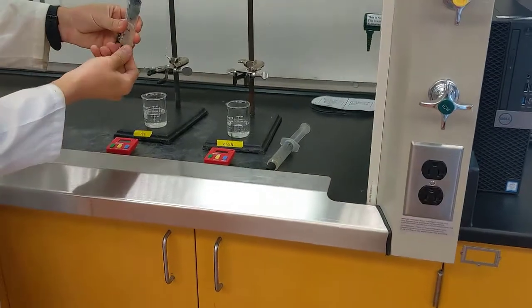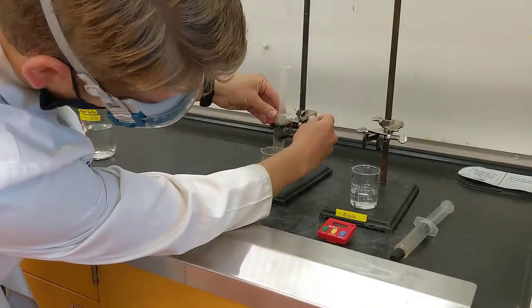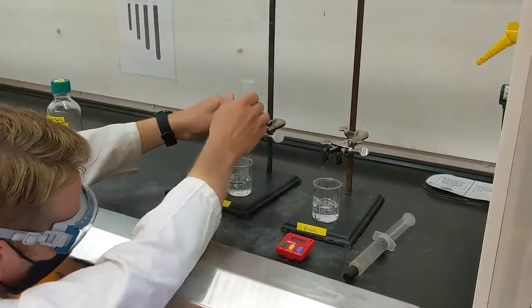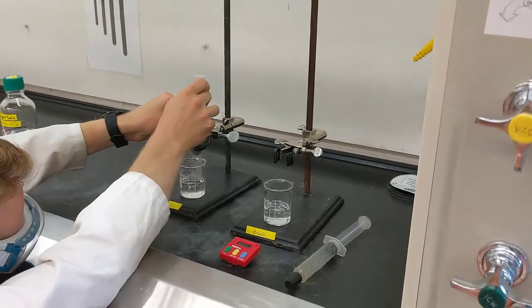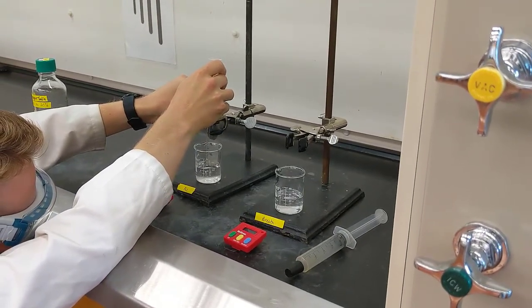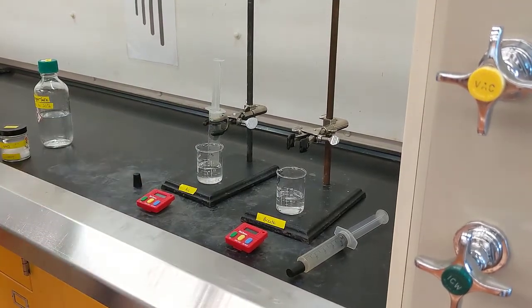And I like taking off the little rubber piece on the bottom, and I'll use my clamp to hold this in the solution so that the tip is submerged. After I have it submerged, I'm going to suck up just a little bit of solution so that it's starting exactly at 0.0 milliliters. Once it's set there, I'm going to start my timer.